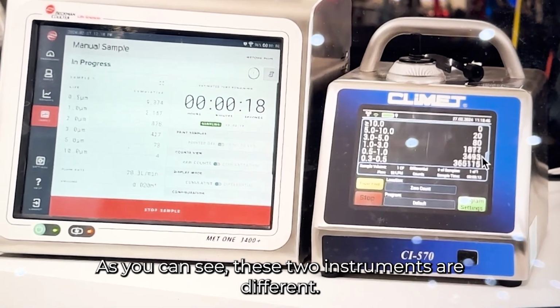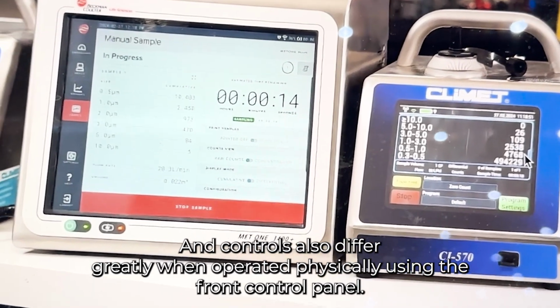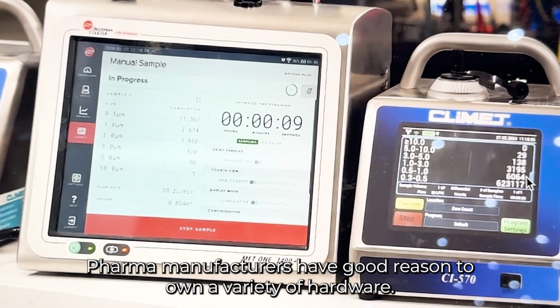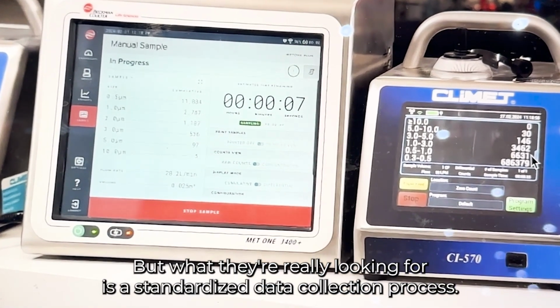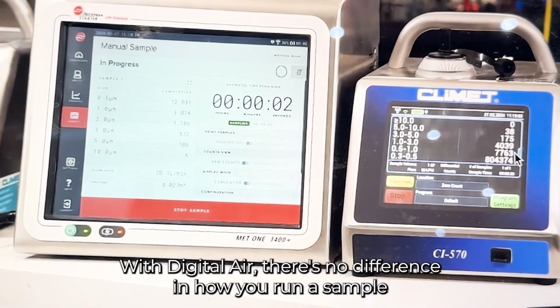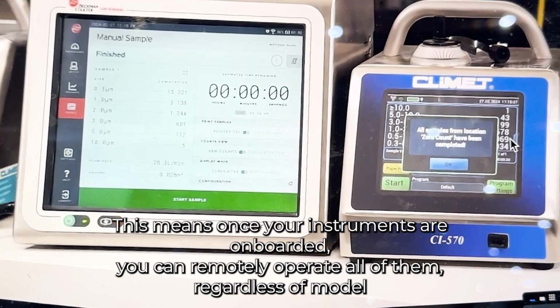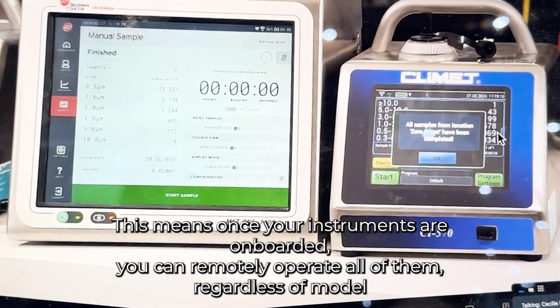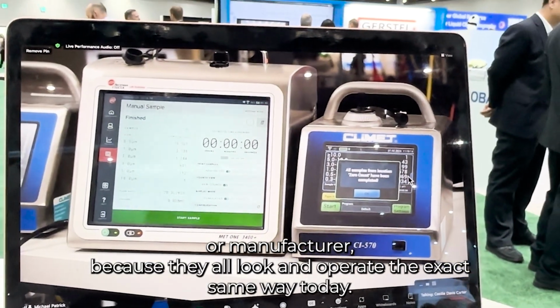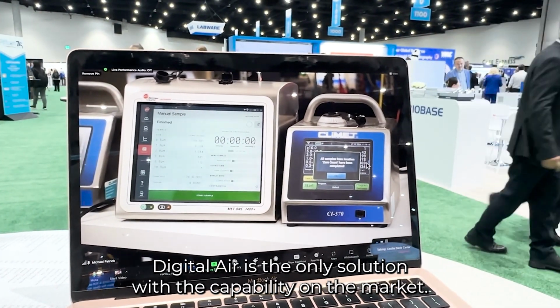As you can see, these two instruments are different. Their functionality and controls also differ greatly when operated physically using the front control panel. Pharma manufacturers have good reason to own a variety of hardware, but what they're really looking for is a standardized data collection process. With Digital Air, there's no difference in how you run a sample or how its data is viewed or collected from the UI itself. This means once your instruments are onboarded, you can remotely operate all of them regardless of model or manufacturer, because they will all look and operate the exact same way. Today, Digital Air is the only solution with this capability on the market.